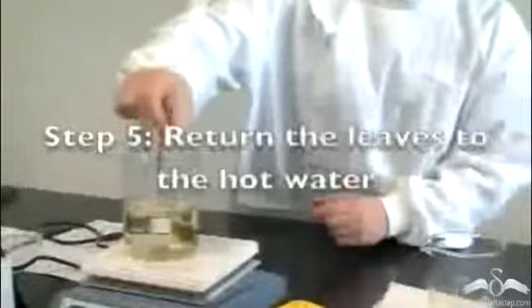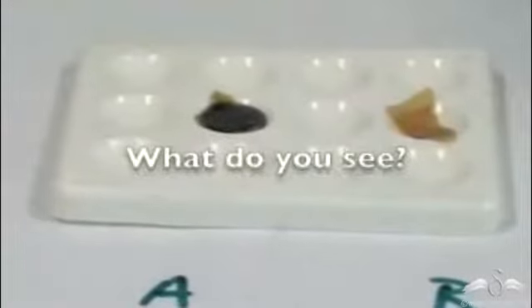Now, after some time, take out the test tubes, drain out the alcohol, and take the leaves and put them back in boiling water. Now, after that, pour some iodine solution on both the leaves. Now, this leaf, which was exposed in sunlight, immediately showed a blue-black coloration, whereas this leaf that was foil wrapped and was not exposed to sunlight, when iodine was applied, remained brown.